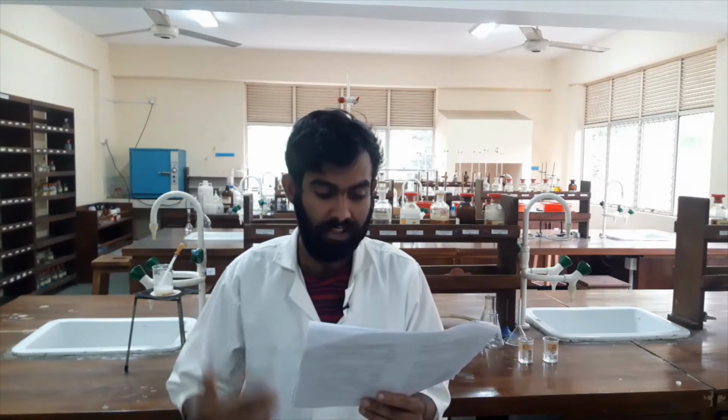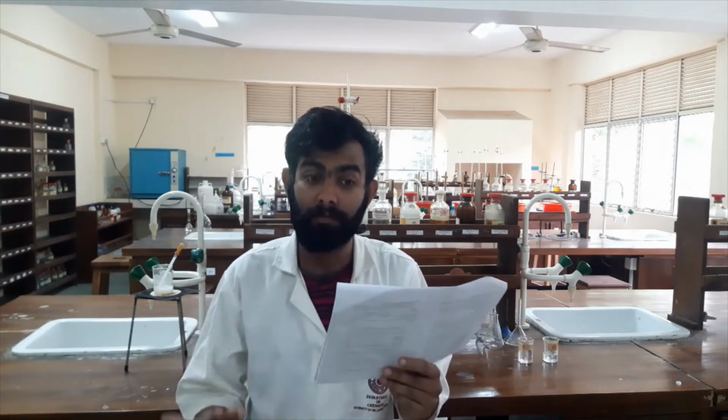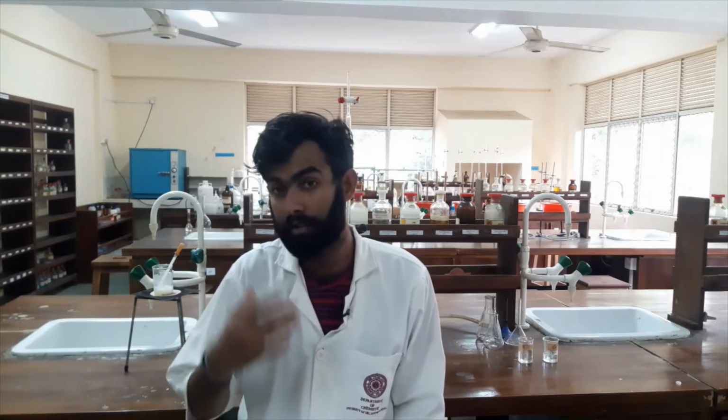Welcome, all, to today's video. Today I am going to do another important experiment, which is the determination of copper in copper sulfate solution using iodometric titration. Here we will do a titration to find out.